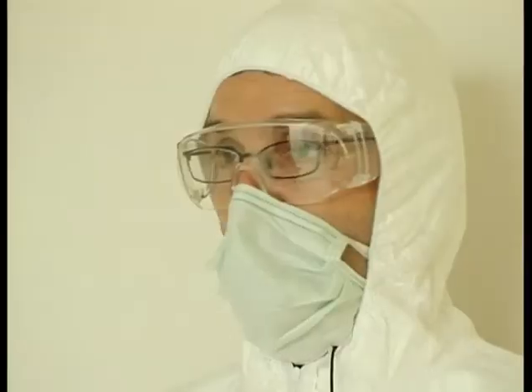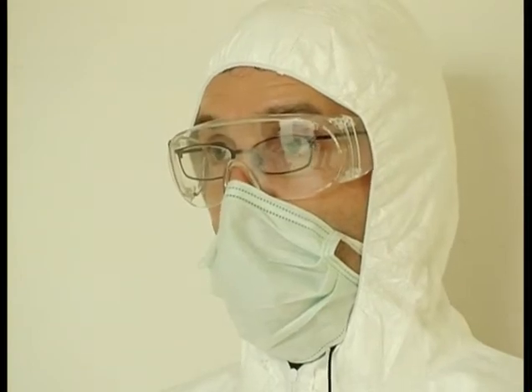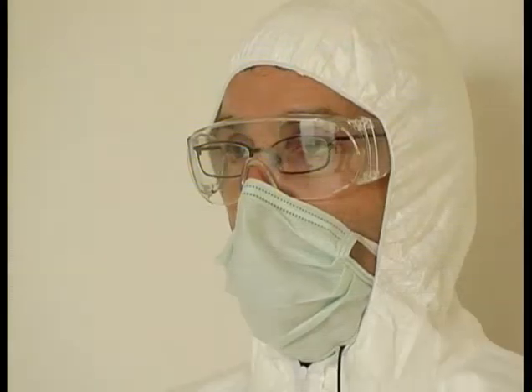You also have other false positives that are found more or less everywhere. This is why we can't draw up an exhaustive list. Even though they turn up really everywhere, even in nature, it is easy to distinguish false positives because, as we have seen, the reaction is not quite the same. The intensity of the blue is different, and really not blue at all, more of a whitish color. In particular, the kinetics of the reactions are much flashier when products like bleach are involved. Or they take a much longer time, as can happen with certain paints.